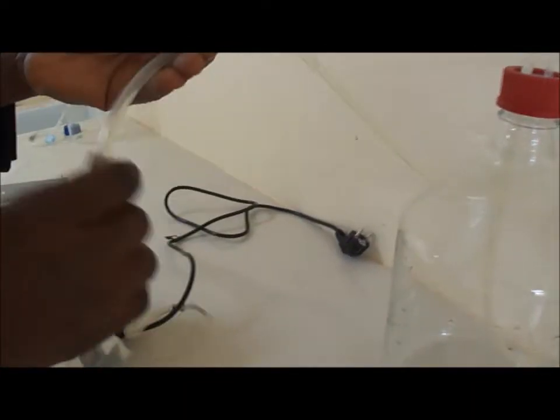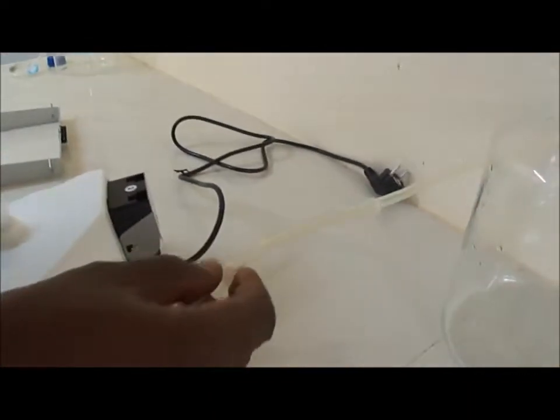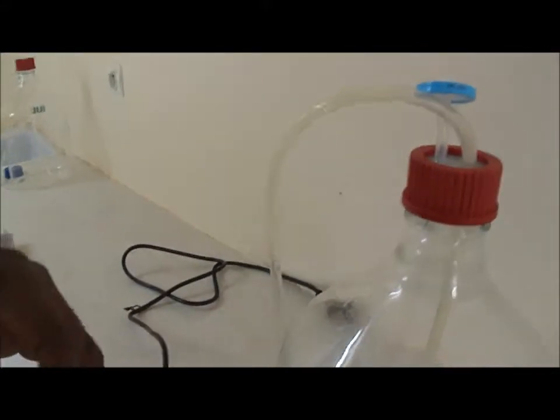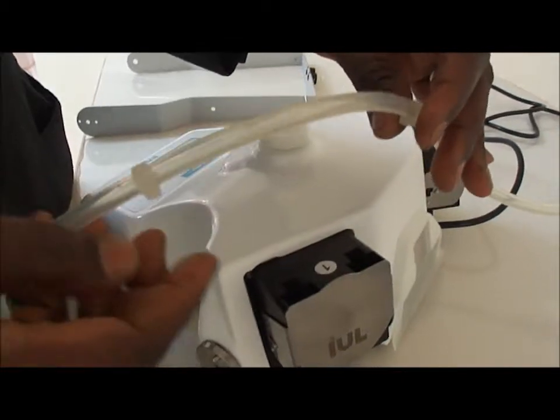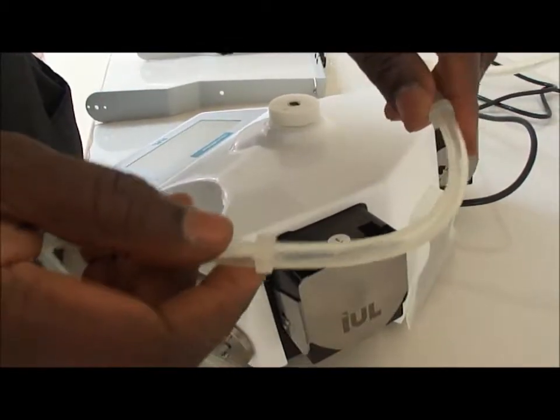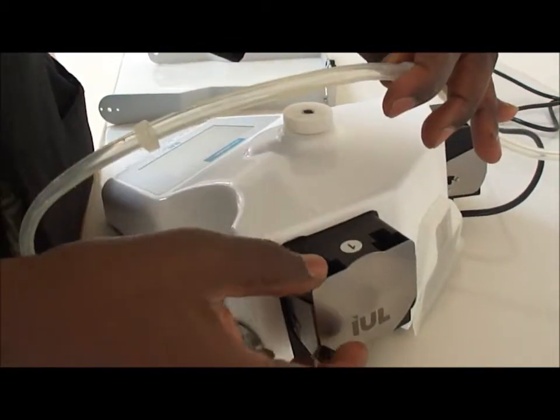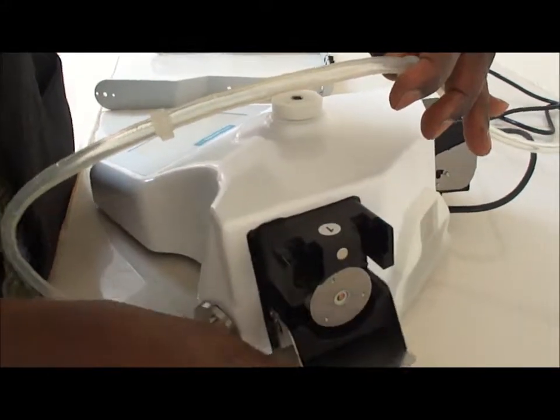You should remark these two small buttons which will serve to maintain in position the pipe inside the pump opening here.